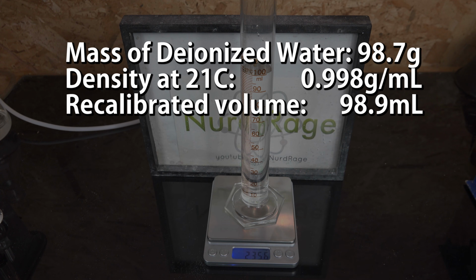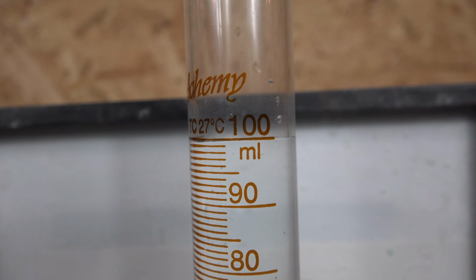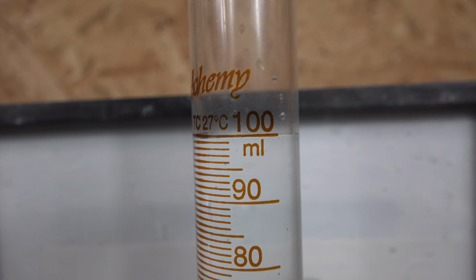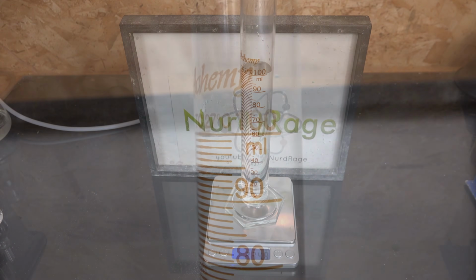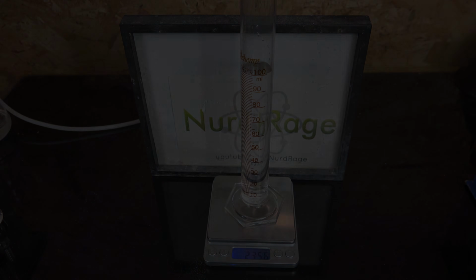I'll be honest though, I don't bother trying to calibrate my graduated cylinders as it takes too much time for not much improvement. There's also the issue that because of the wide neck, the surface tension and reading errors on the meniscus make for unavoidable errors that cannot be calibrated out. Nonetheless, almost every chemist has a graduated cylinder, so for measuring density of a liquid, this is the bare minimum. With the basics out of the way, we can now go on to some more specialized equipment and techniques.